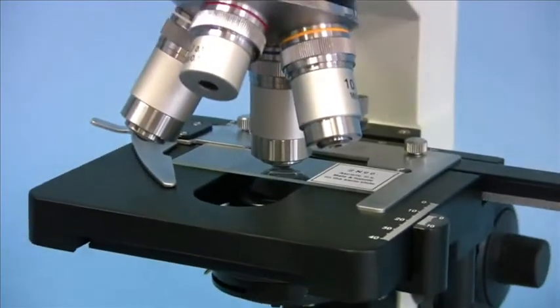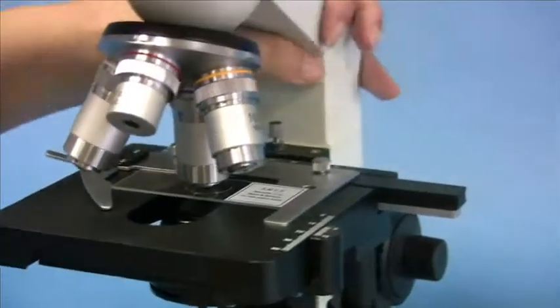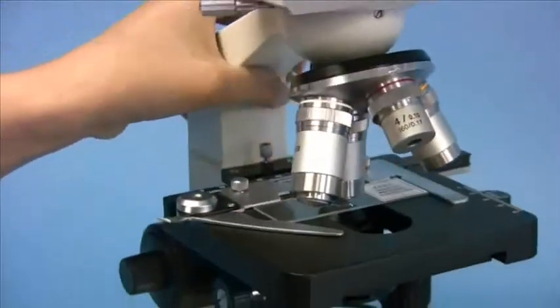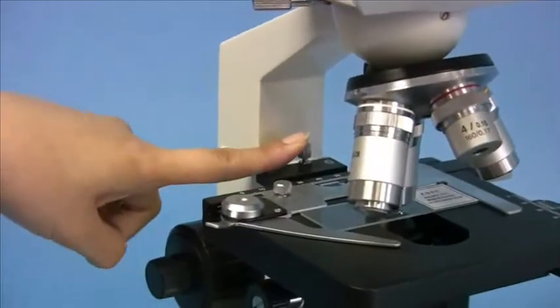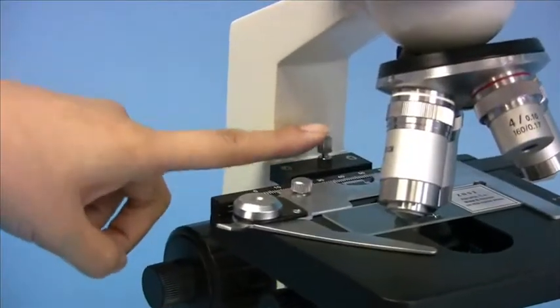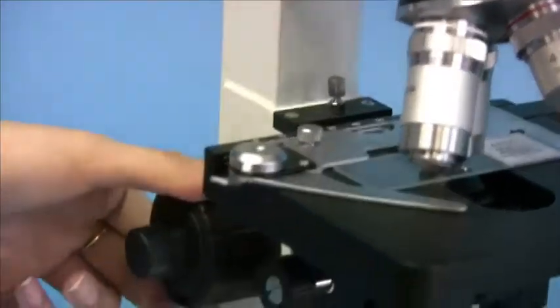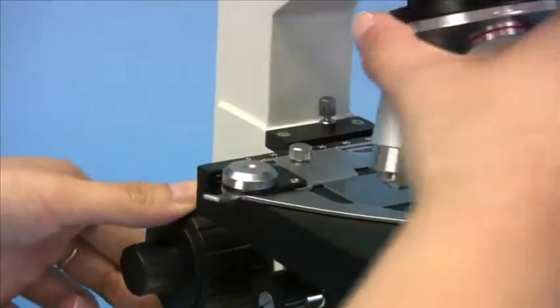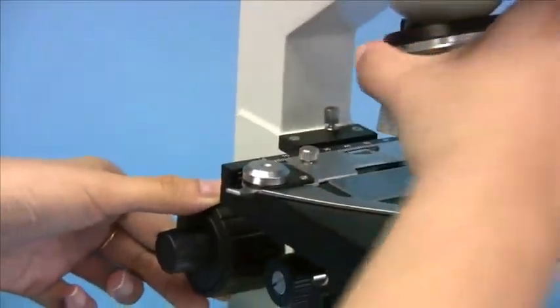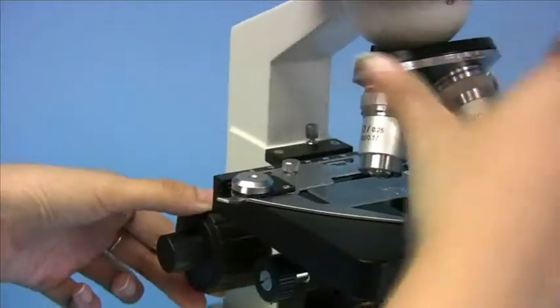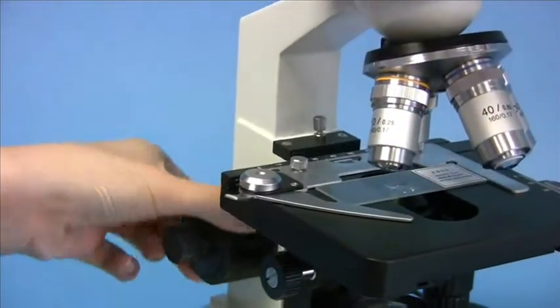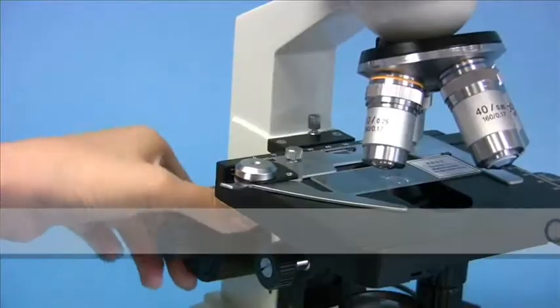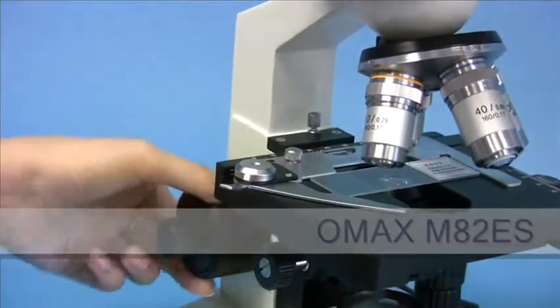On top of this protection, the stage also has an upward moving lock that sets the upper limit of the movement of the stage. As you can see here, I cannot adjust the stage to a higher level than this.